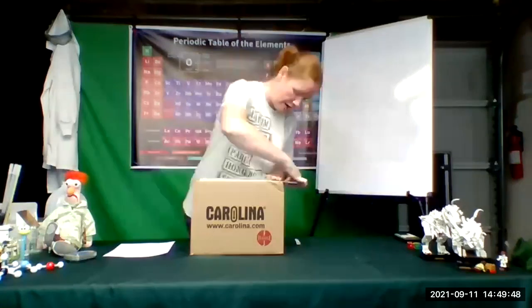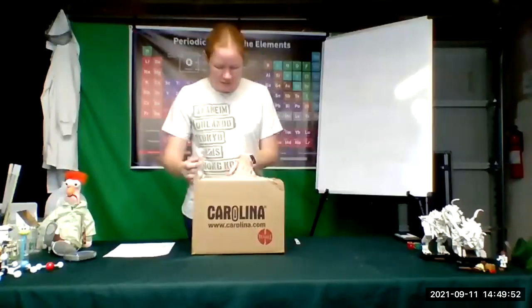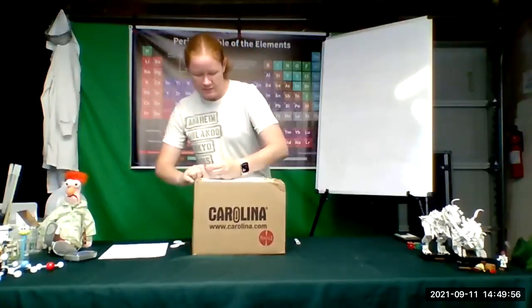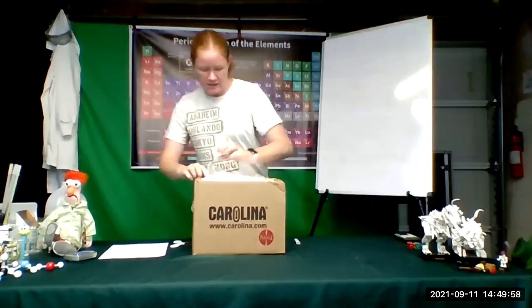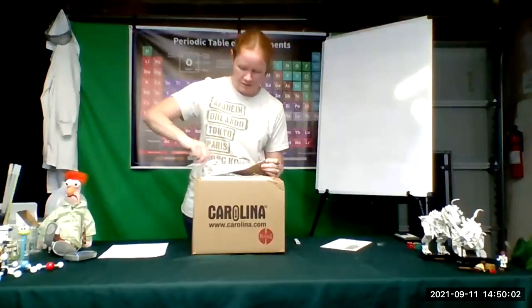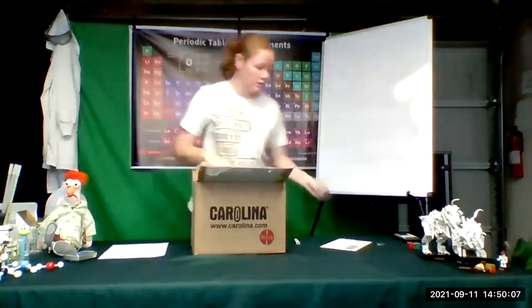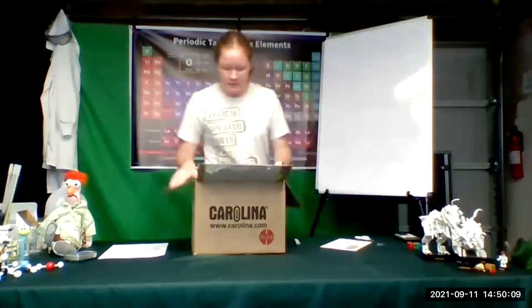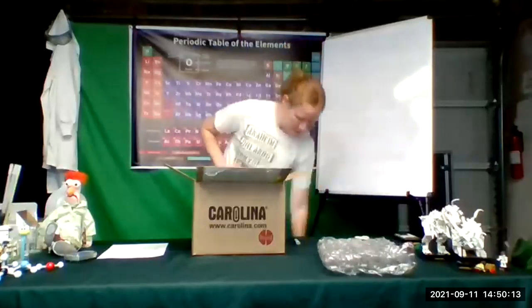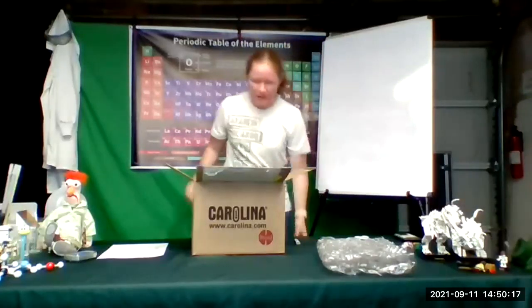All right, so I'm going to go ahead and slice into mine, preventing myself from cutting my packing slip here. So I'm going to pull that off, get that out to the side, then I can go ahead and finish over here. All right. Okay, so when you open it up, you'll find that we've got some bubble wrap in there that was there to protect everything. Now we can go through each of the components and see what we've got.